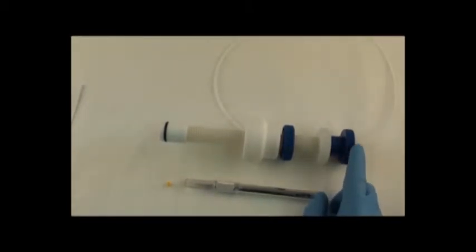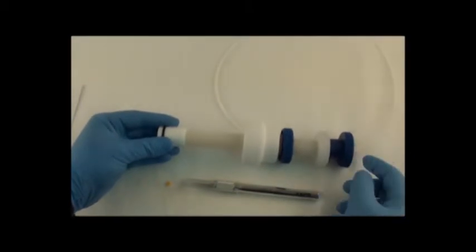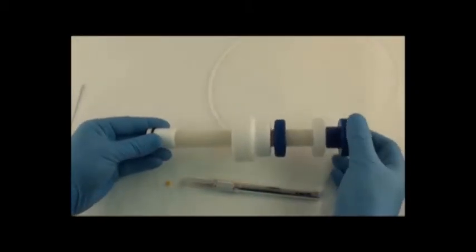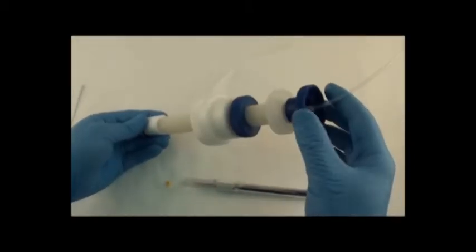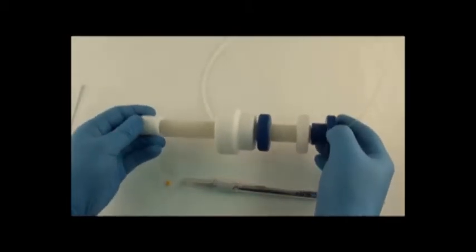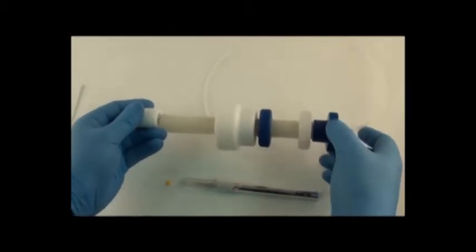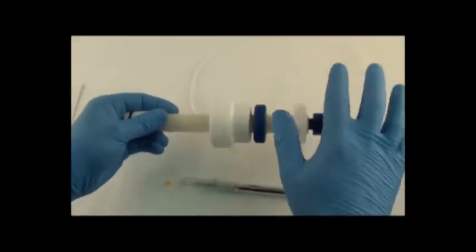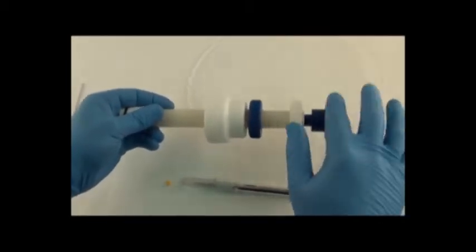So first of all to start the process I have to take the top knob off. So I hold the end fitting and unscrew this top knob and inside there's a stainless steel rod that's threaded. So this is a long threaded rod.